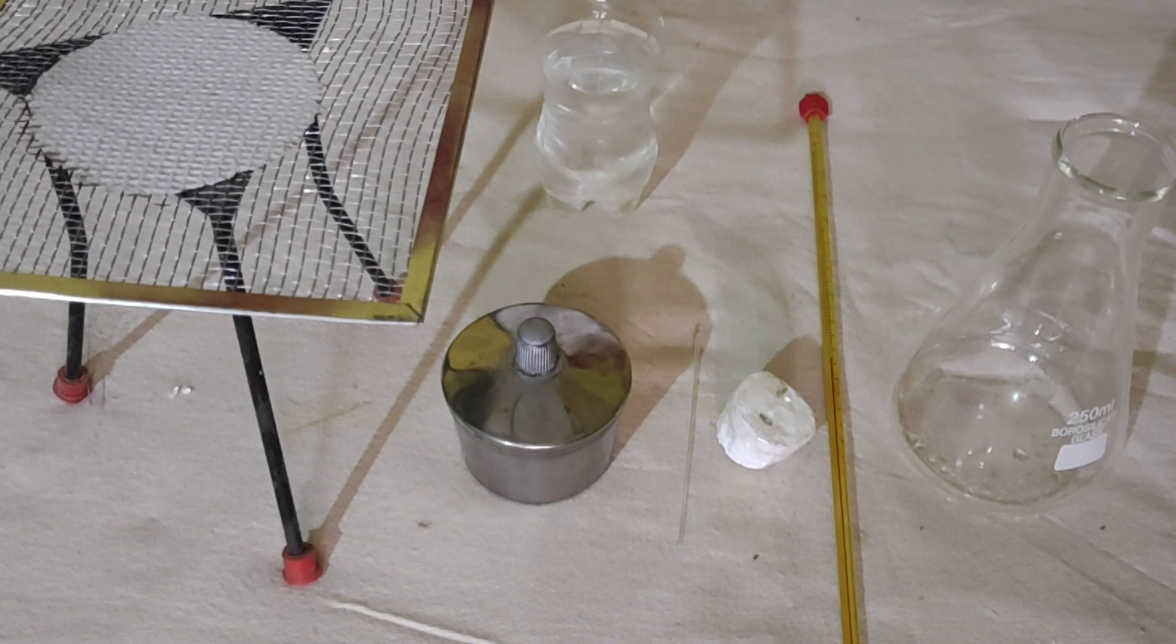So, today our activity is: how will you determine the boiling point of water and melting point of ice?